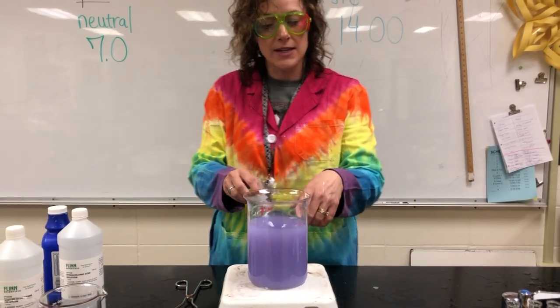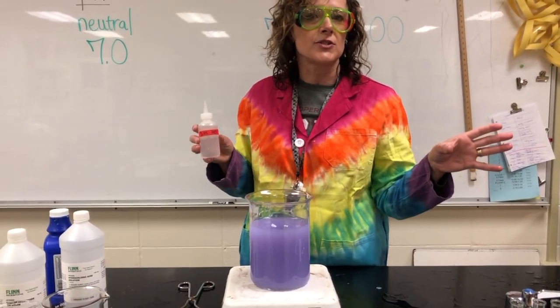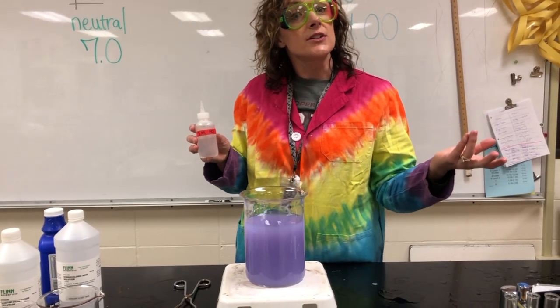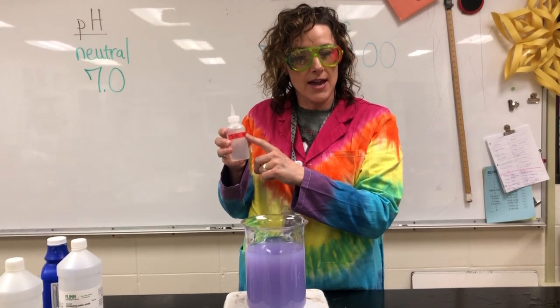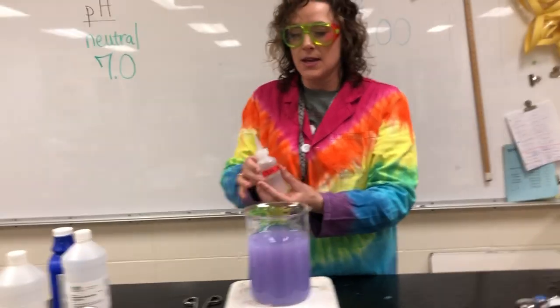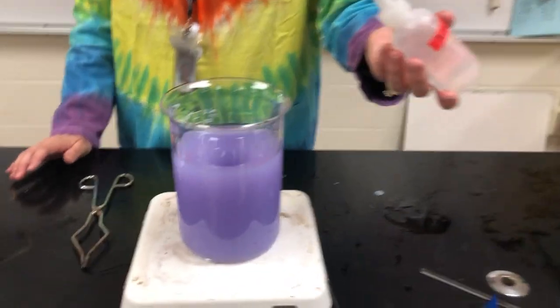What I'm going to add to the magnesium hydroxide is hydrochloric acid. So I'm just doing a neutralization reaction. You just learned about writing net ionic equations, so think this is a strong acid reacting with a weak base. So what we want to zoom in on, Zoe, is what happens whenever we add it.